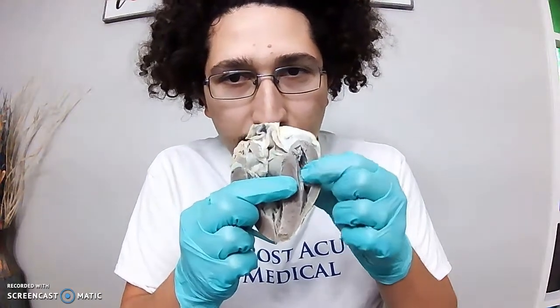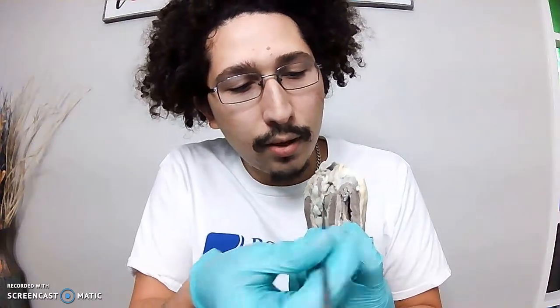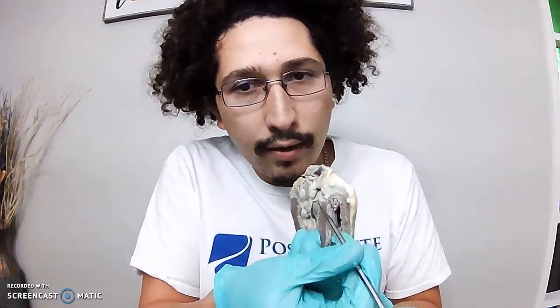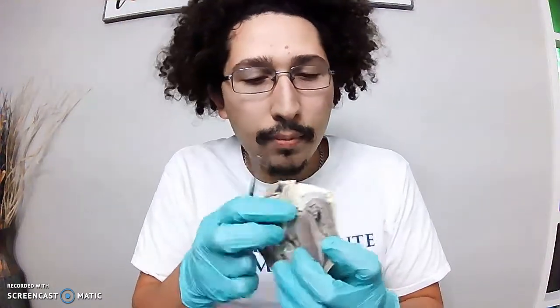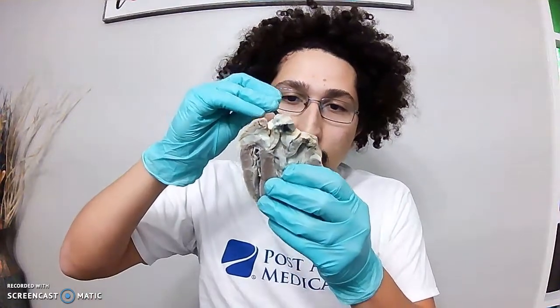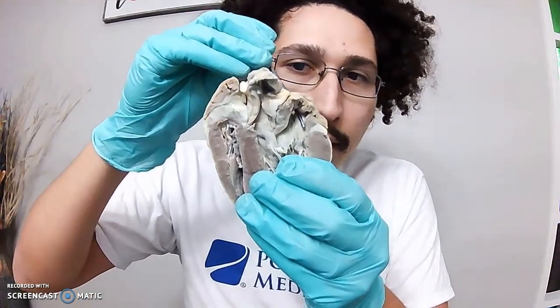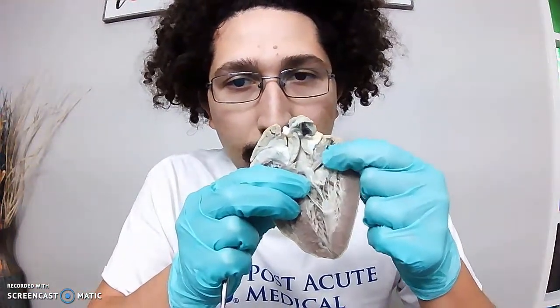Okay, I'm going to grab the anterior portion. So we'll flip around. This is still the right ventricle. So when that ventricle contracts, that deoxygenated blood goes up through the pulmonary valve right here. That's the pulmonary valve. And it goes up through the pulmonary artery. And that takes the deoxygenated blood to the lungs, where it is then oxygenated and then comes back through pulmonary veins into the left atrium. This is the left atrium right here.